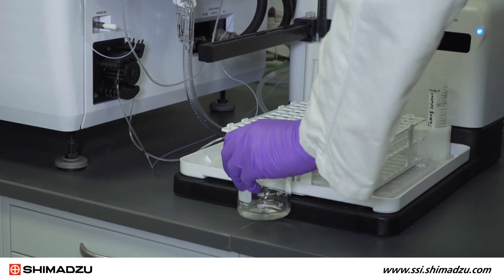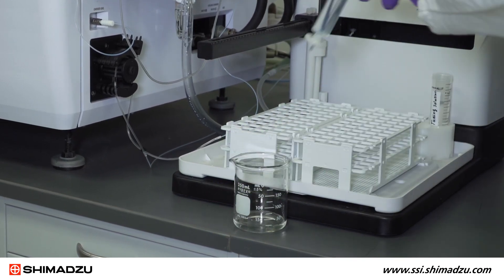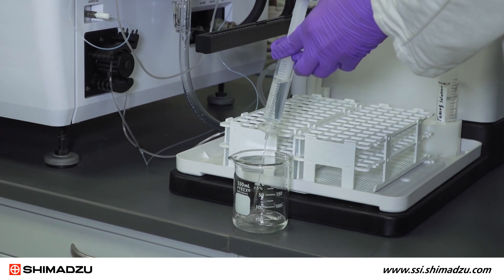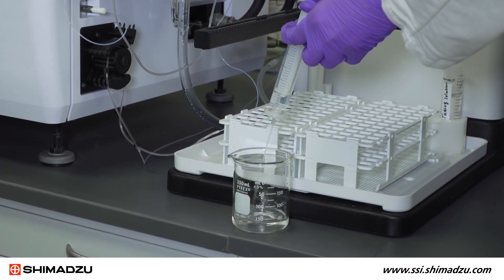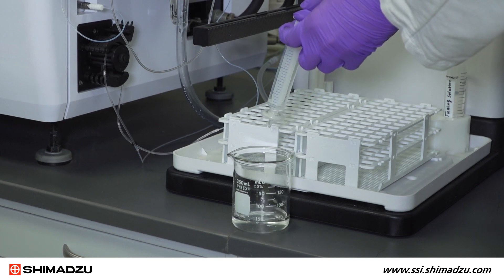Sample tubing can become partially or completely clogged by particles in the sample. To avoid this problem, you can filter your samples after digestion using 0.45 micron PTFE filters.